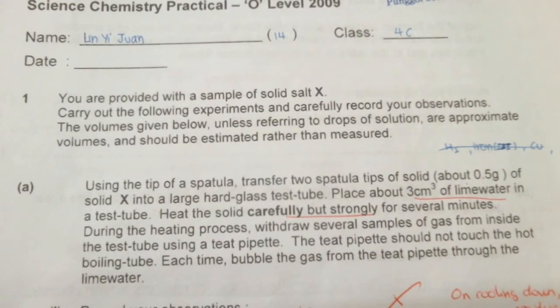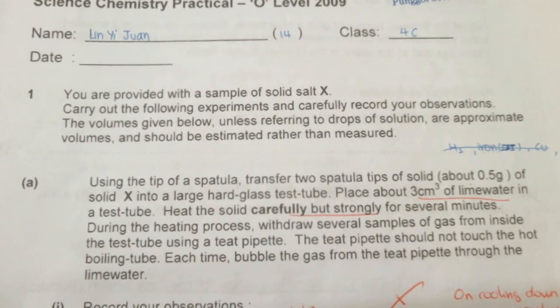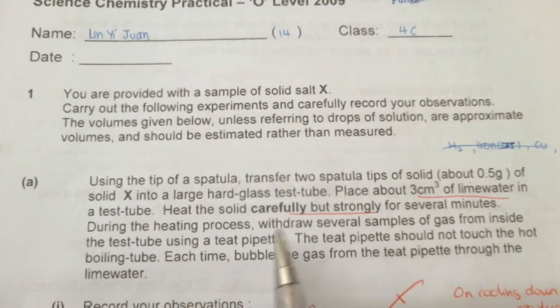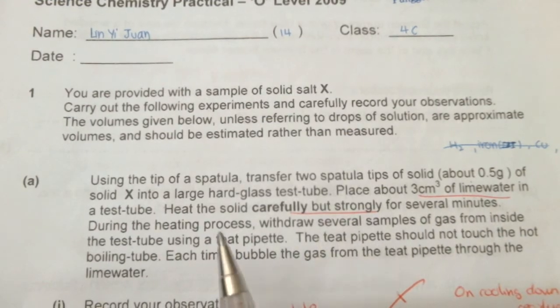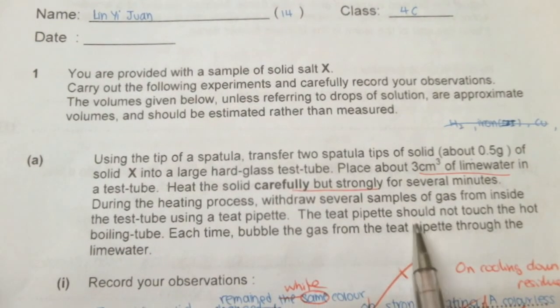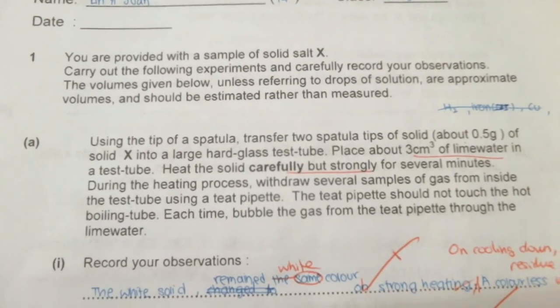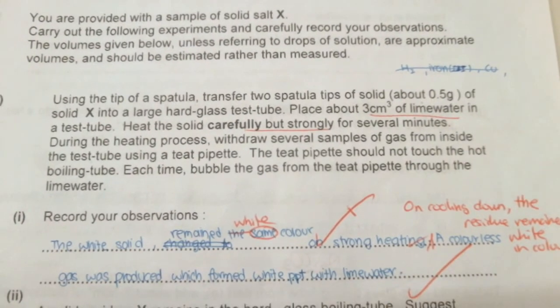In this 2009 paper, the first part requires you to heat solid X strongly. When you read this portion, a lot of students make a mistake — they think you put the lime water into solid X and heat strongly. But be careful: what it means is to put the lime water in another test tube and heat solid X strongly in a separate test tube. During the heating, you withdraw the gas and bubble it into the lime water, just as you would when testing for carbon dioxide gas.